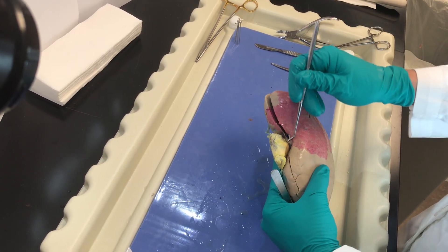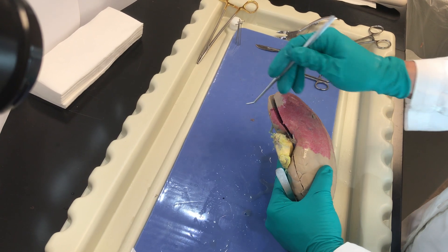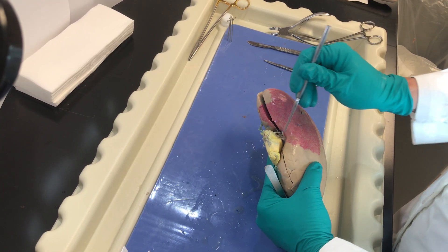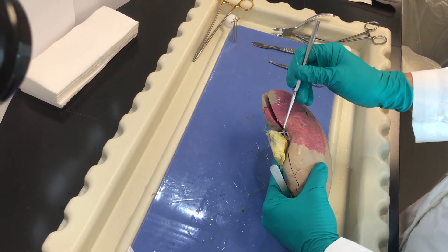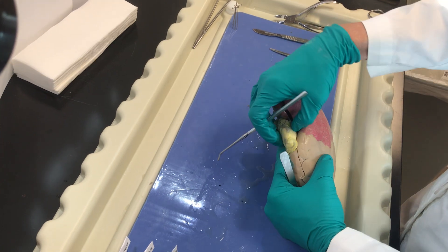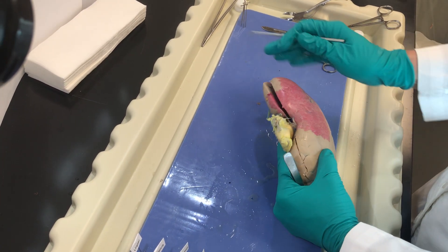Remember, this is where my renal artery and vein will be coming in and going out respectively, and then of course the ureter, which has been cut and tied off here.